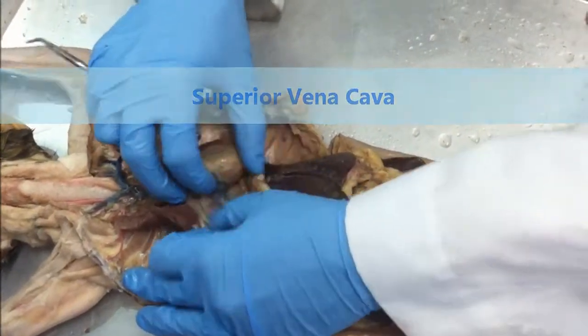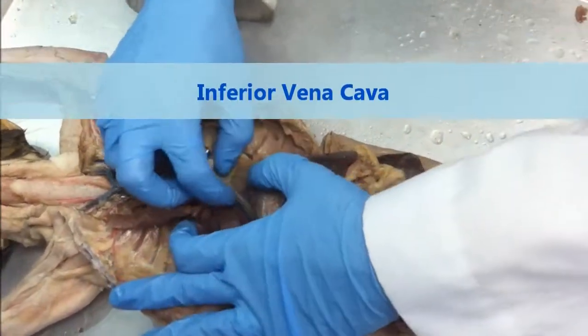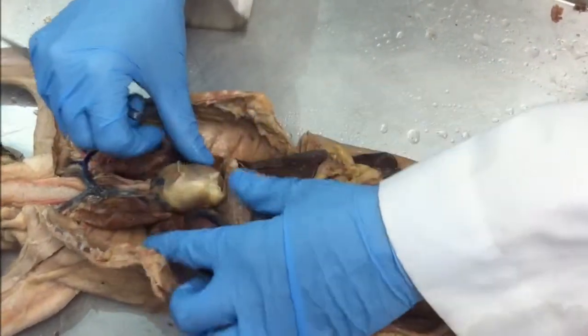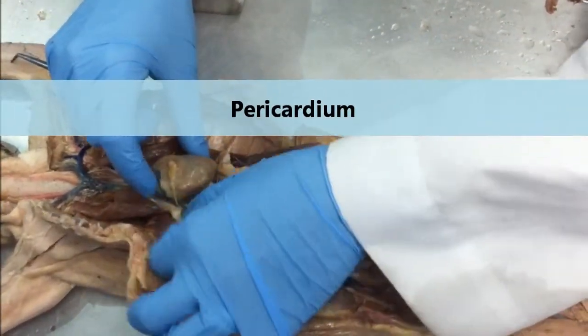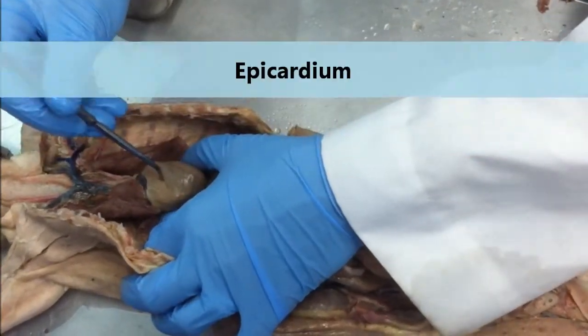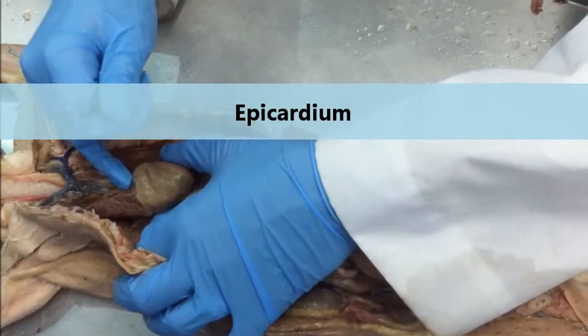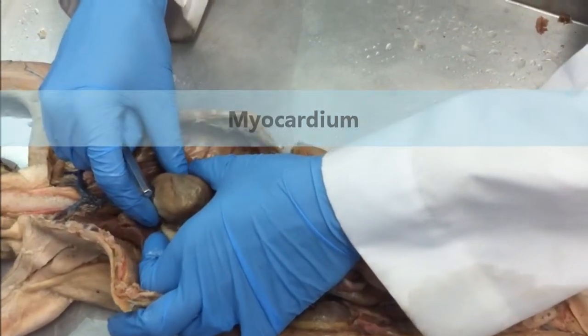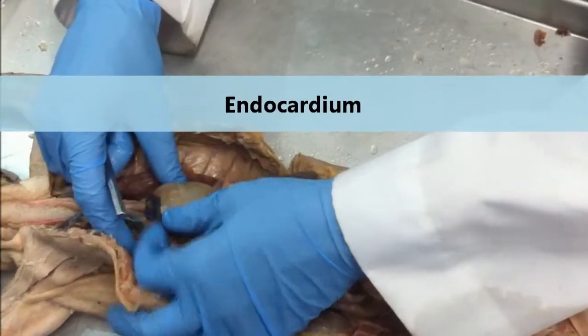Behind the heart, we're going to go down through the lungs into the inferior vena cava. Surrounding the heart, we have the pericardium. If I put a pin through this outer layer of the heart, it would call it the epicardium. Inside of the heart, the muscle layer is called the myocardium. Inside the chamber is called endocardium.